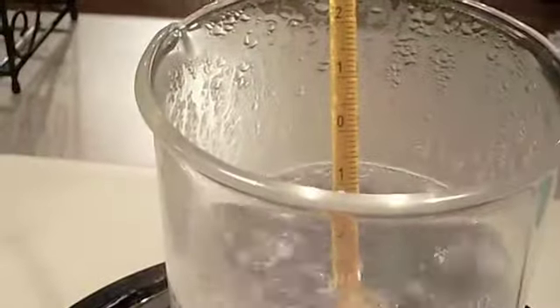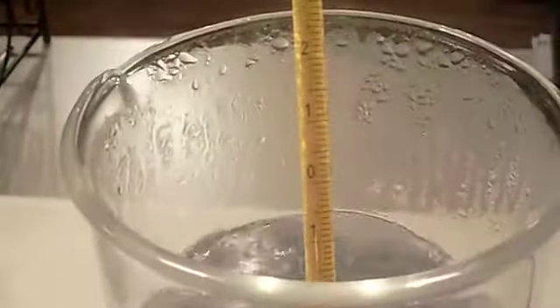And here is minute 17. We're still boiling and we still have gas. So that, boys and girls, finishes our investigation on melting point, boiling point, and freezing point. Water melts and freezes at 0 degrees Celsius.